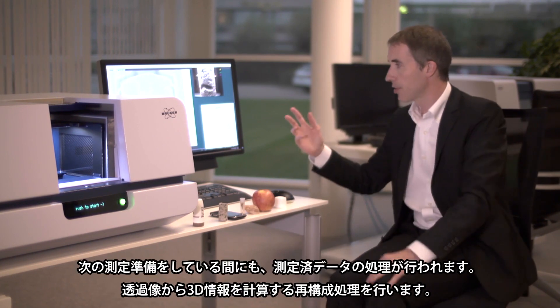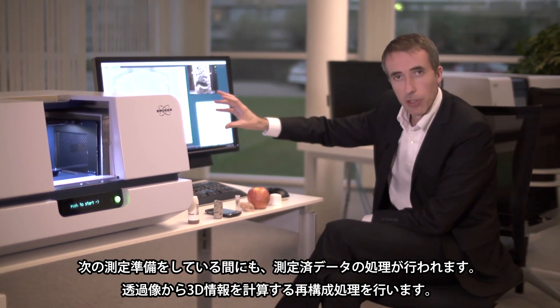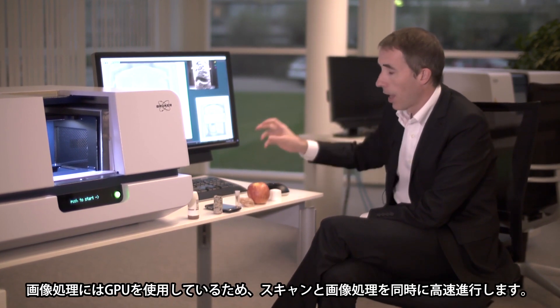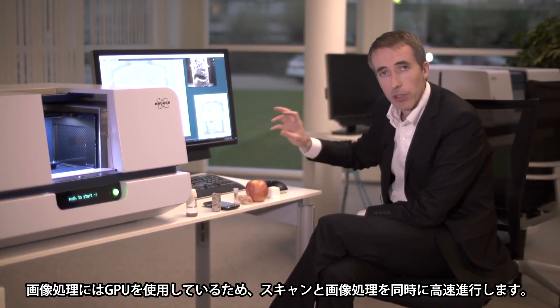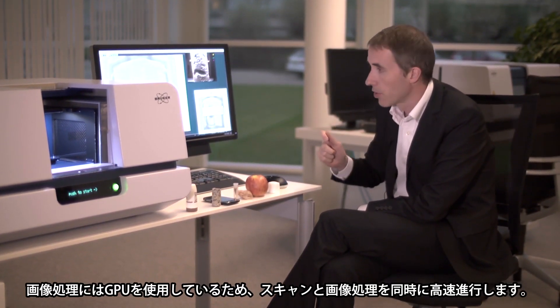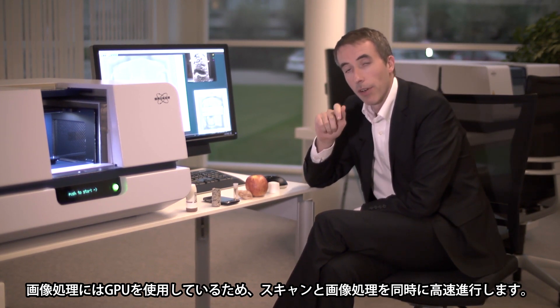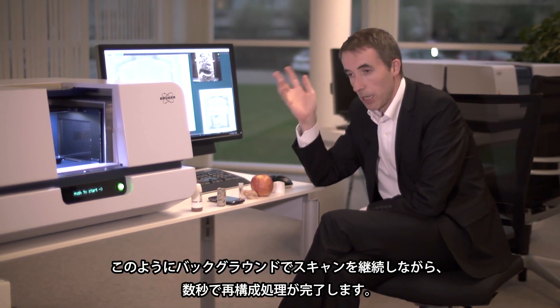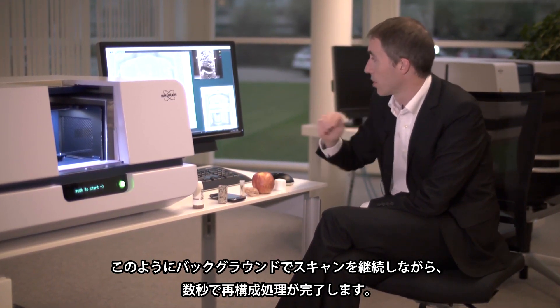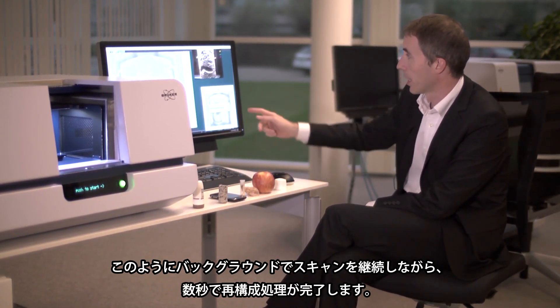In the meantime the data of the projection images is loaded in the reconstruction program, and using the GPU — a graphical card interface — the reconstruction process is very fast. It can speed up the whole reconstruction to a matter of seconds, as you can see here while it's running in the background.